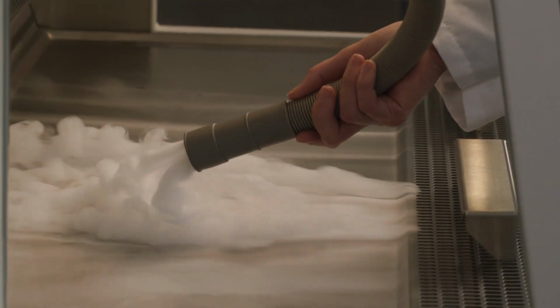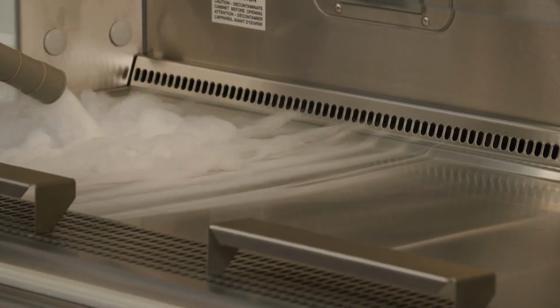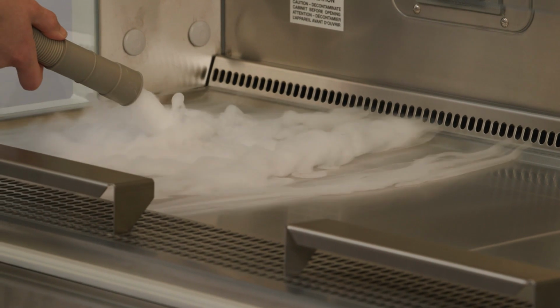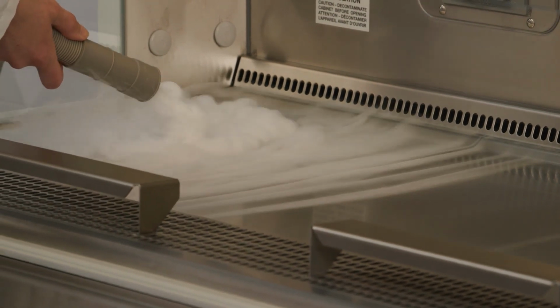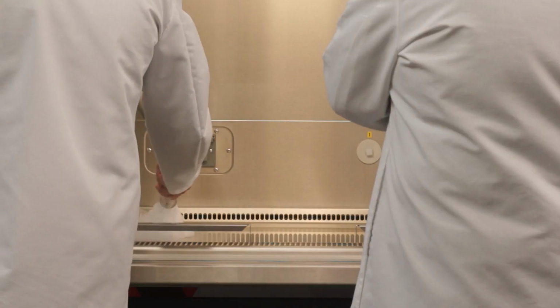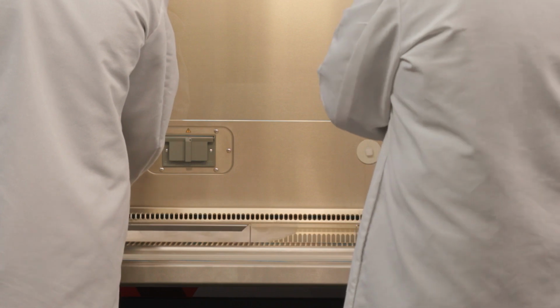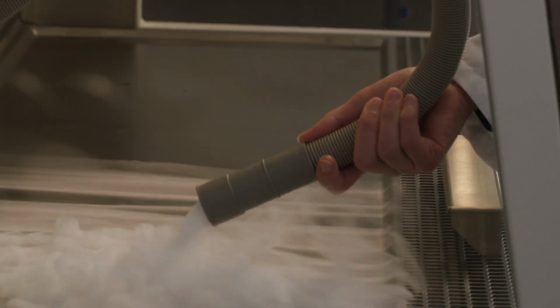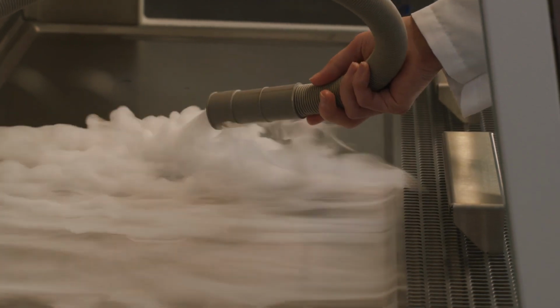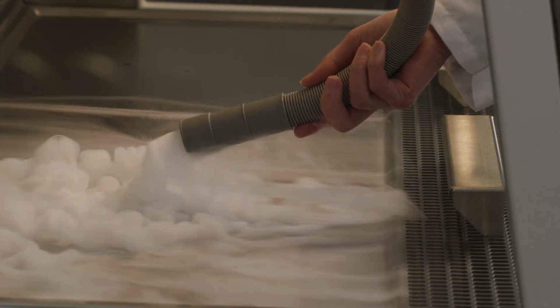So the unidirectional or almost laminar airflow that's downflow limits the cross-contamination, which is why we're always telling people to work clean to dirty. So for the right-handed person, they would have their clean supplies on the right, the dirty waste on the left, and contaminants on the left could not reach the clean stuff on the right. You're right, it really remains localized in the specific area, and that's awesome for cross-contamination. You don't have to worry about your samples getting dirty from one side to the other, contaminating each other.